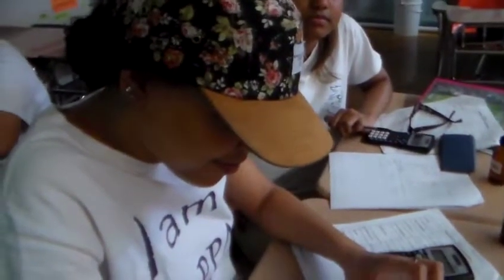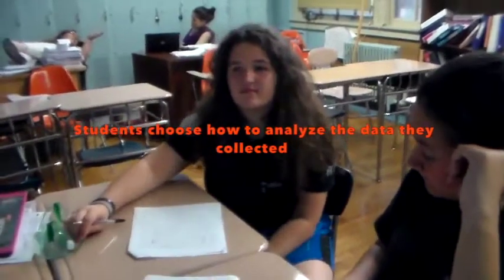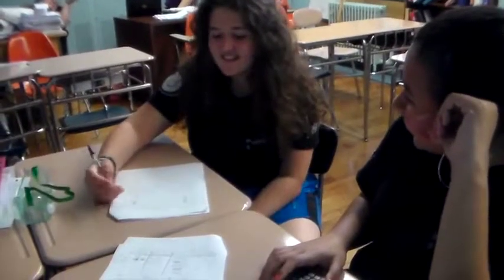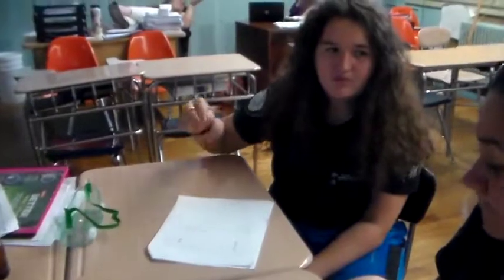Okay. So what data analysis method did you choose first? We chose to find the average, because there are 3 different ones, and we cannot do it for each one of them. It's better if we take the average of all of them. That's what I think. You wanted to find the concentration of what?